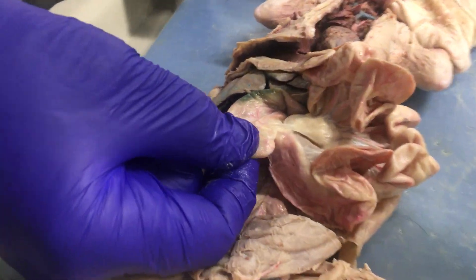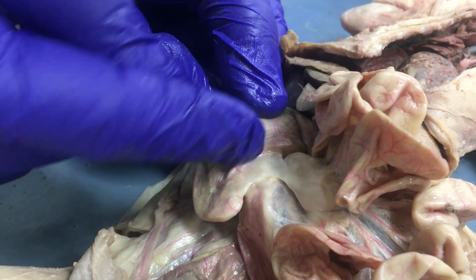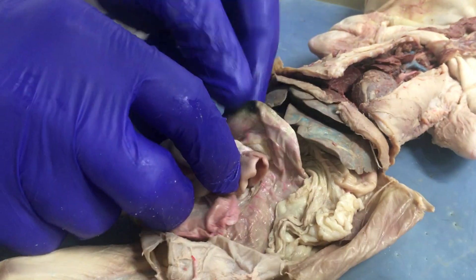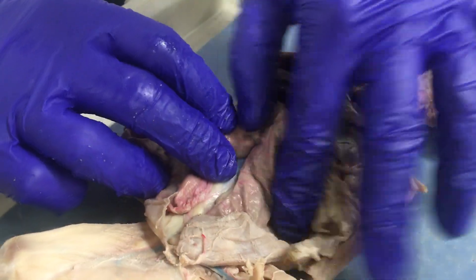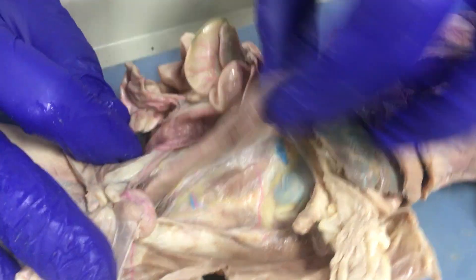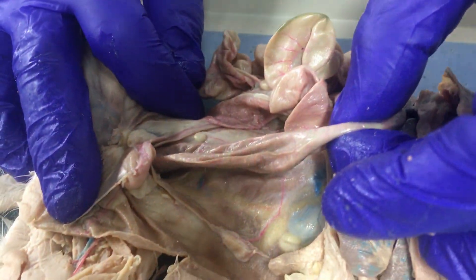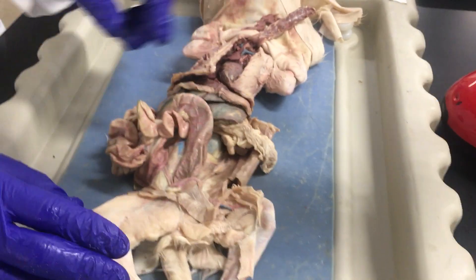The beginning of the large intestine here is the cecum, and then a short ascending colon. Then it makes a U-turn right here and descends into the pelvic cavity as the descending colon. That's the digestive system.